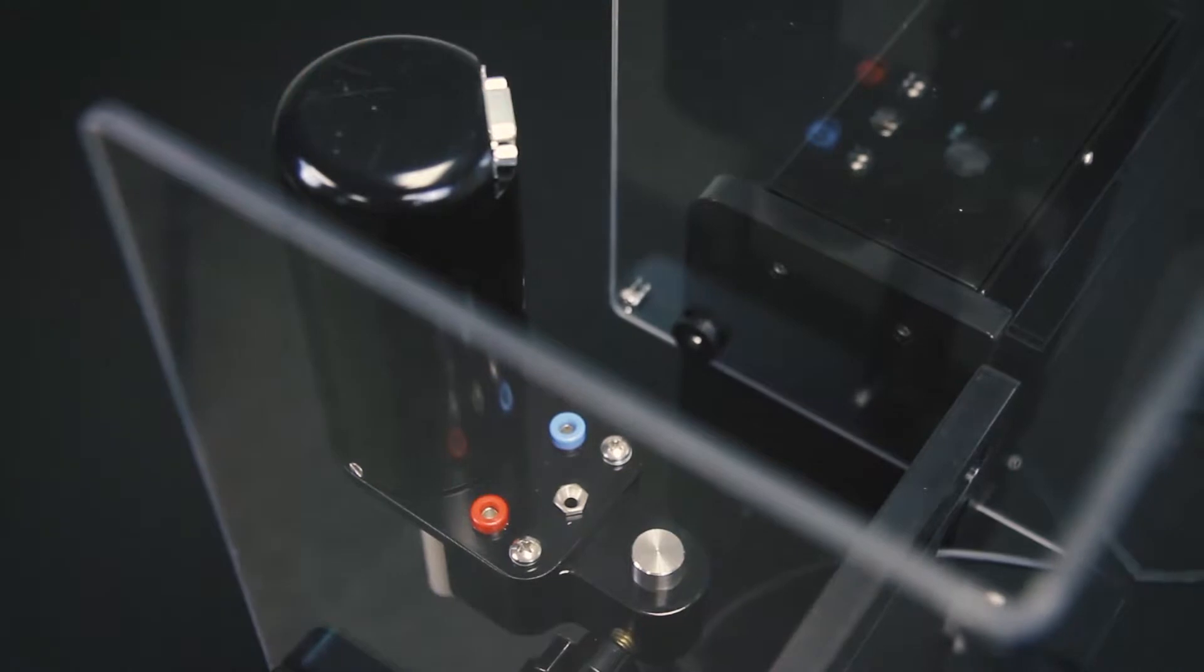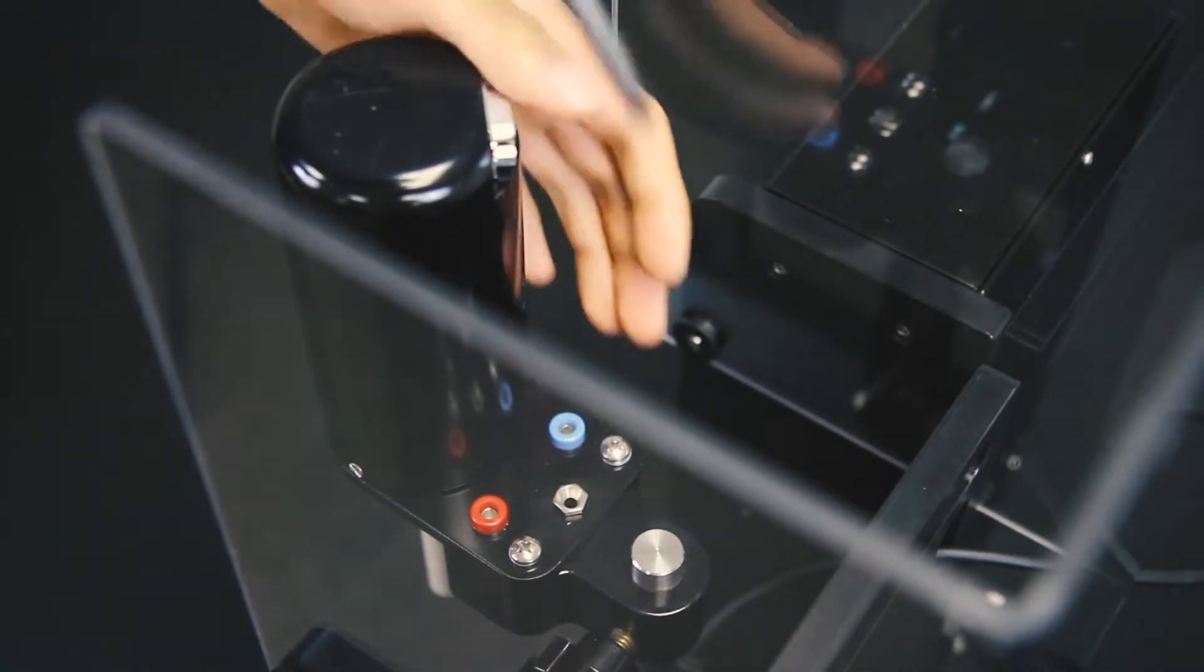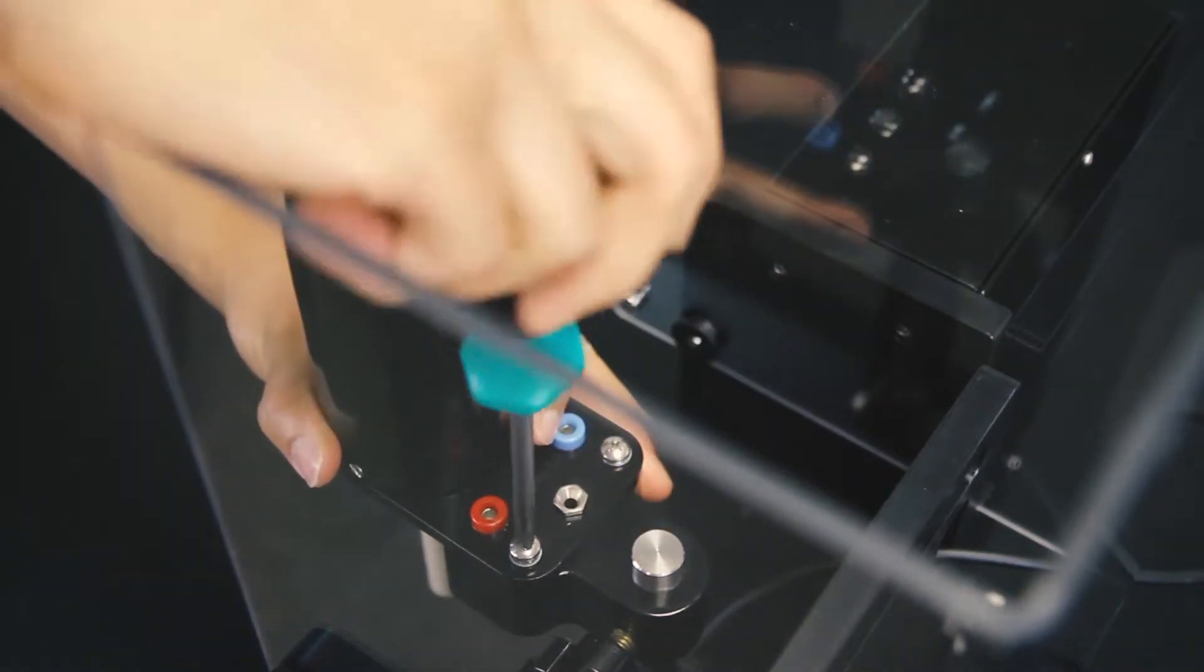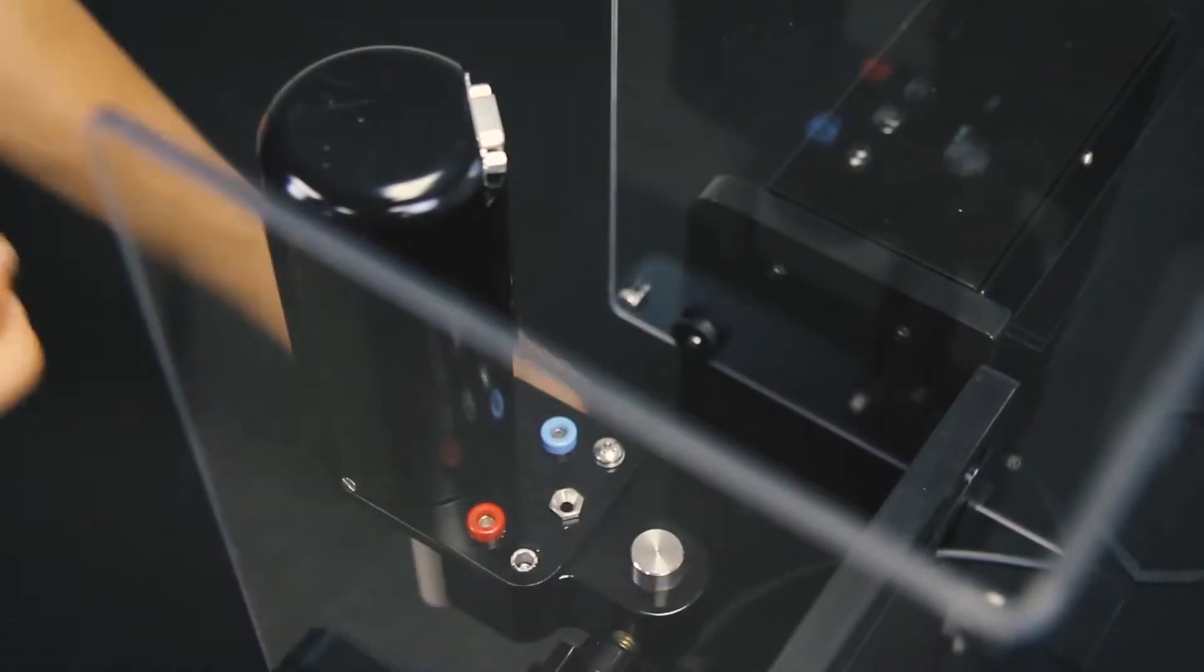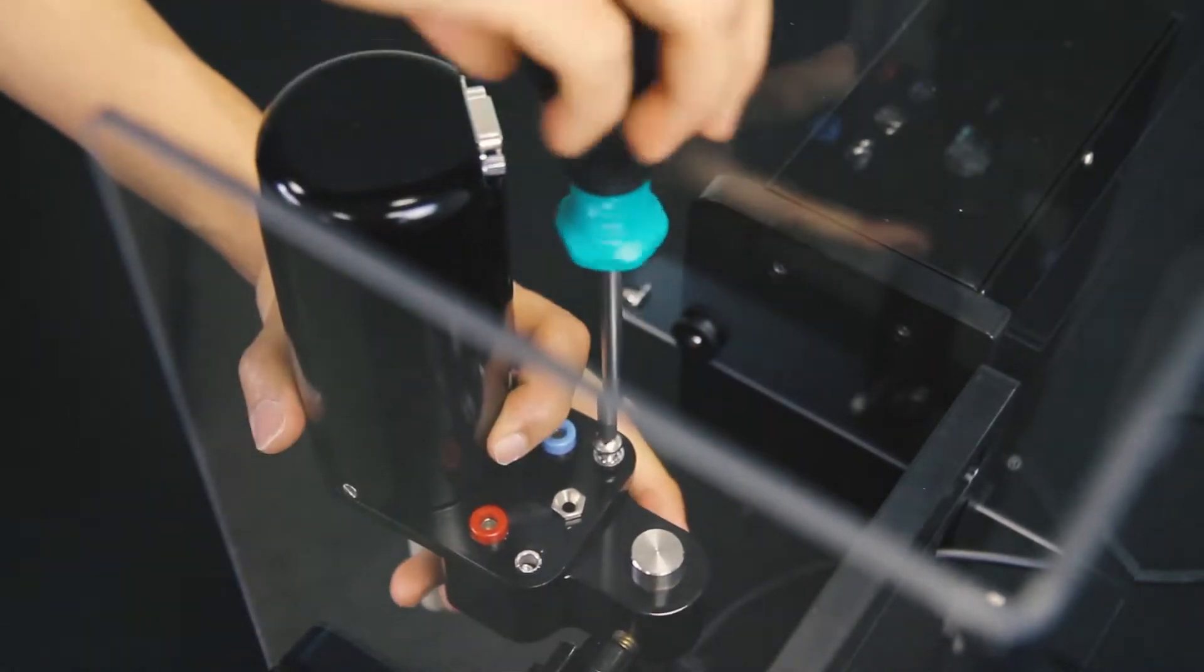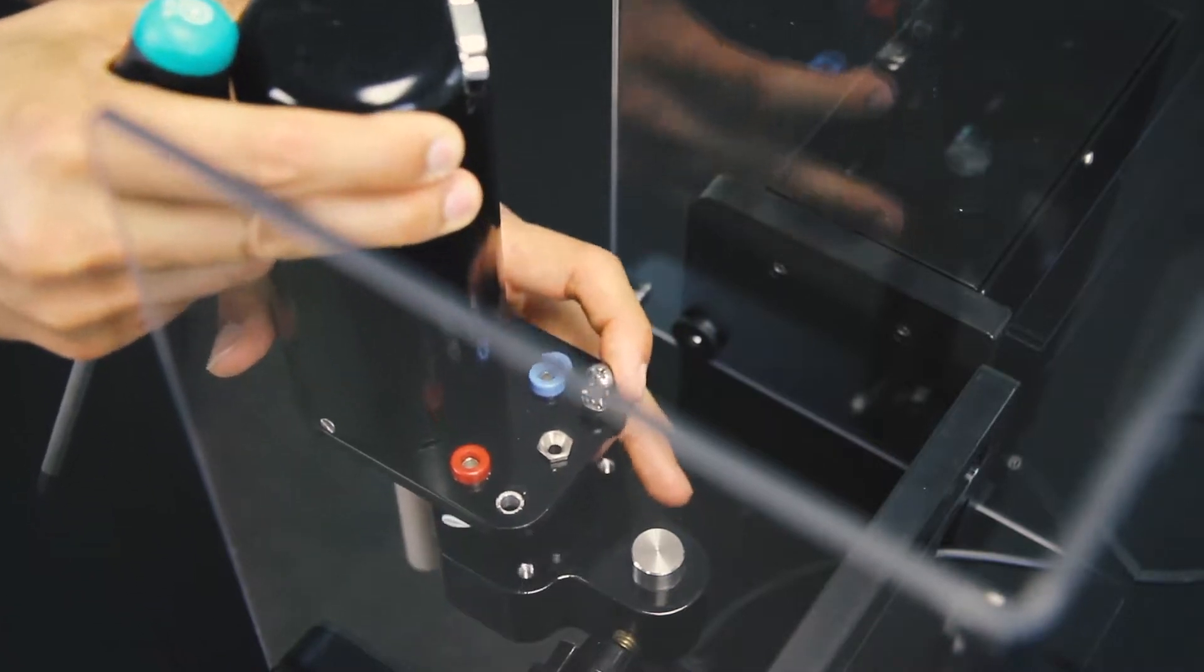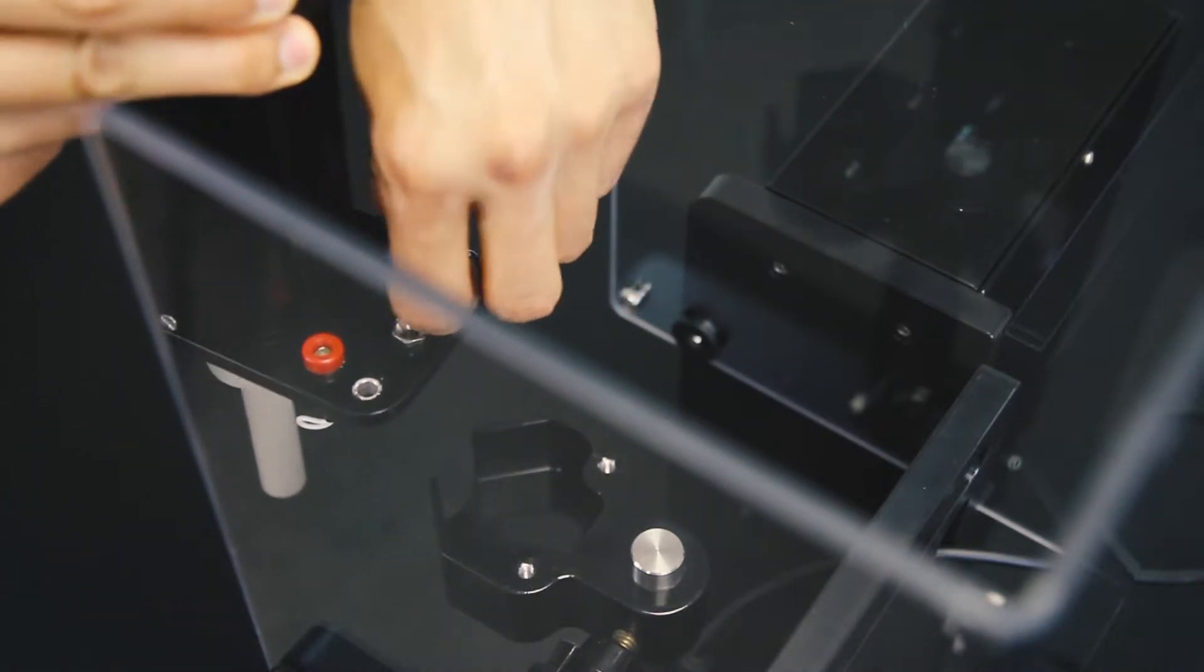On the motor bracket, remove the two screws with the large Phillips head screwdriver. Once the two screws are removed, lift the motor unit off the support rod.